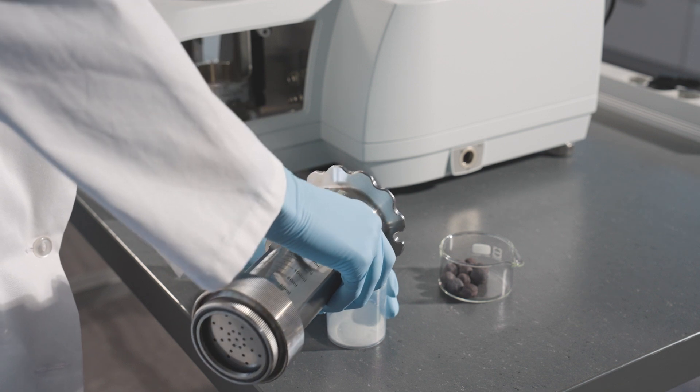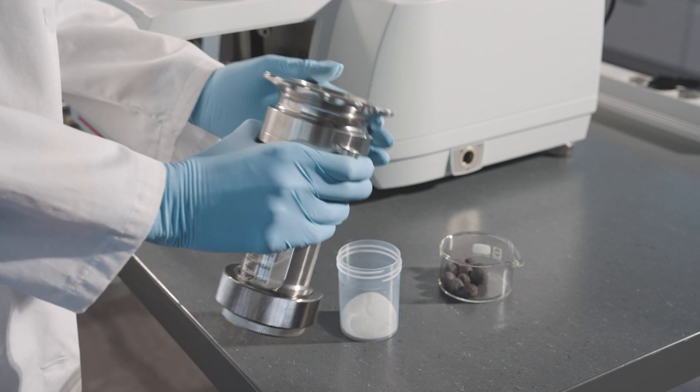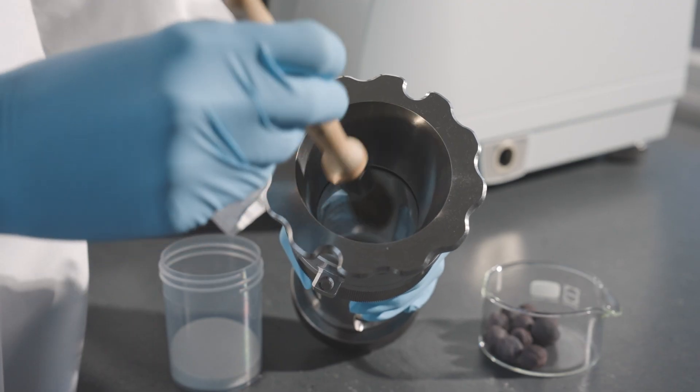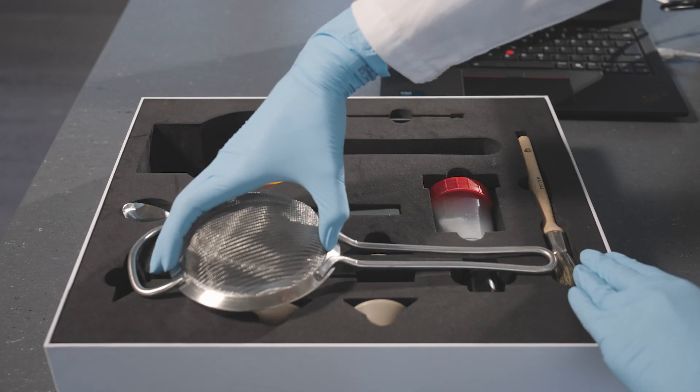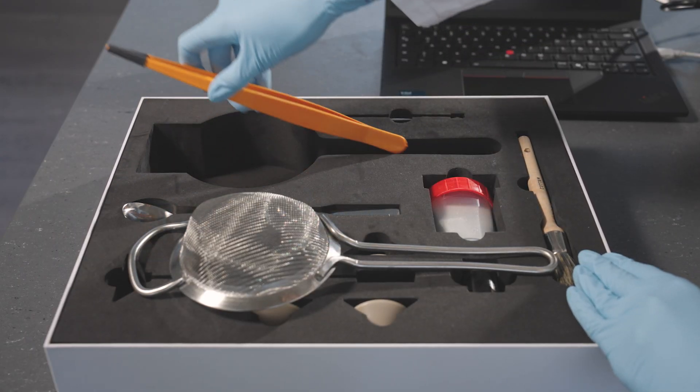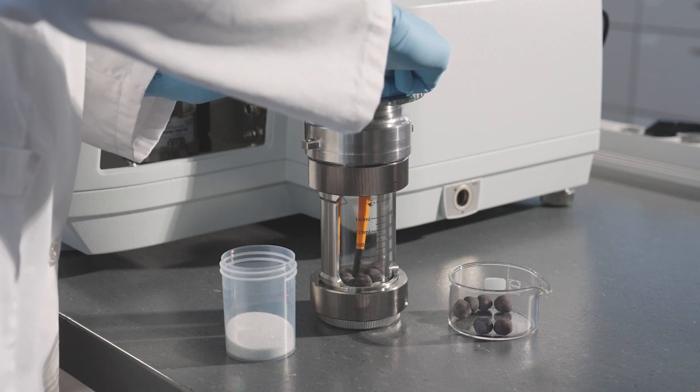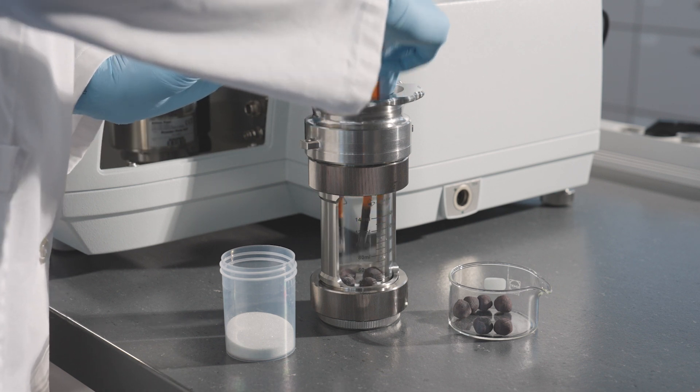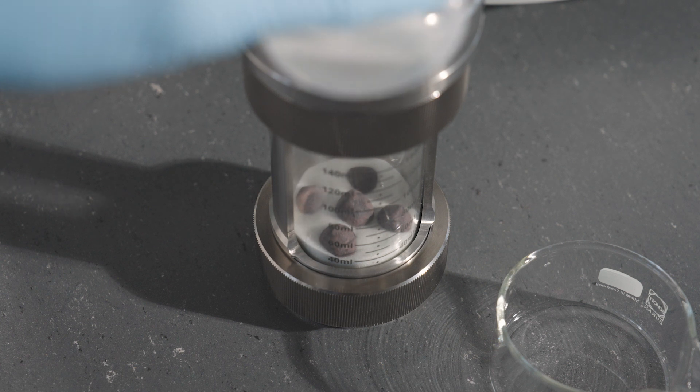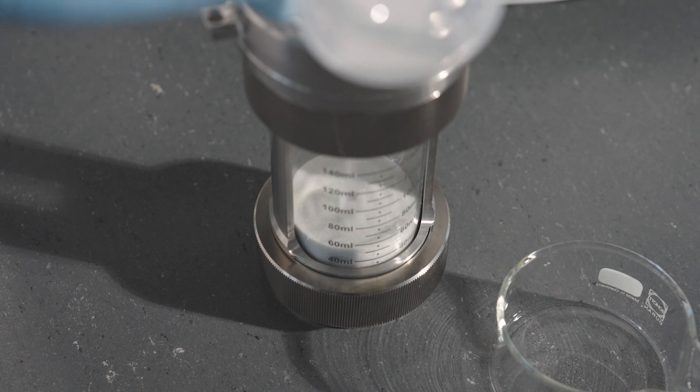Remove two-thirds of the envelope powder. Use tweezers or a spoon to insert the sample. Reload the previously removed powder and pour it over the sample. Cover the sample completely.